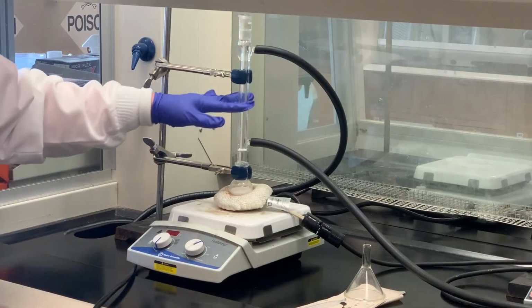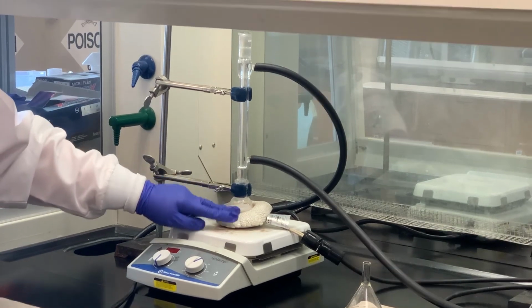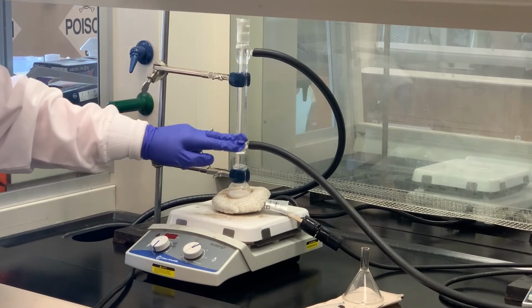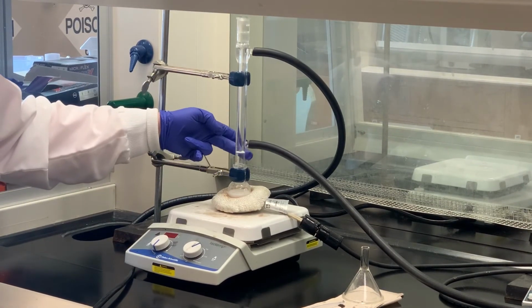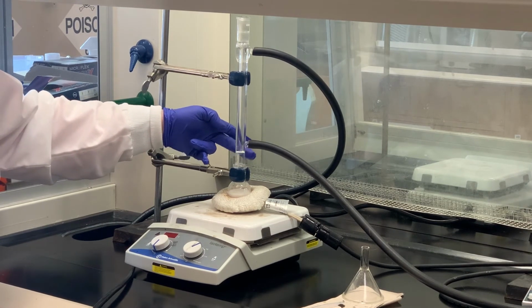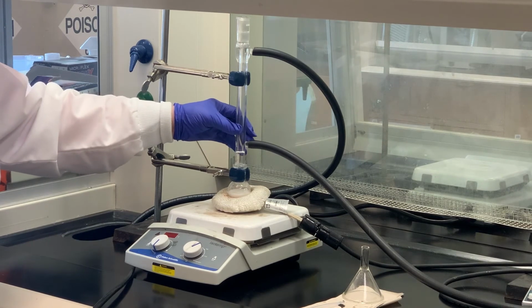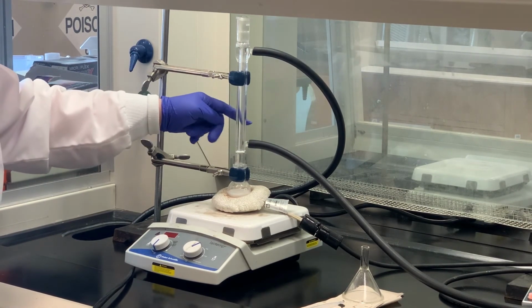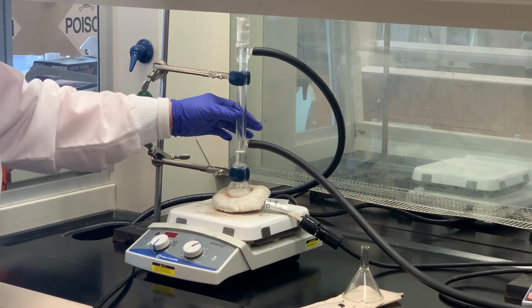I went ahead and set up the apparatus for reflux condensing. We've got the acid in there, as we saw earlier. We've got this white precipitate that formed. I've got water going in the bottom, out the top. Also, anytime you're using these ground glass joints, even if it's not mentioned in an experiment, please take the time to grease those. I also changed my gloves after the addition of sulfuric acid, just a little safety precaution there.